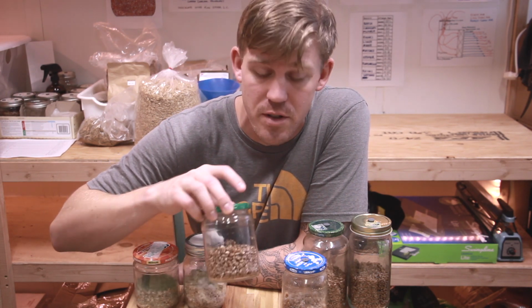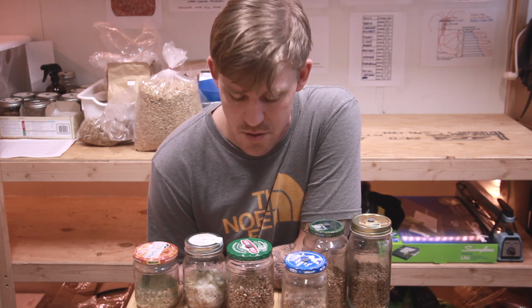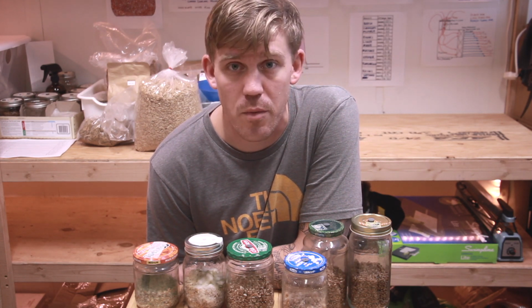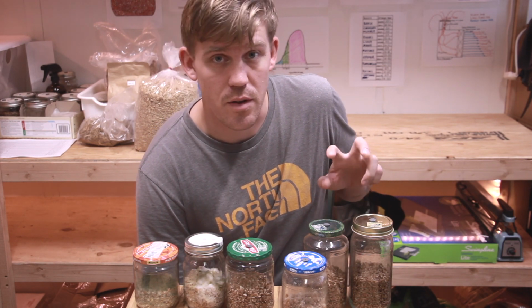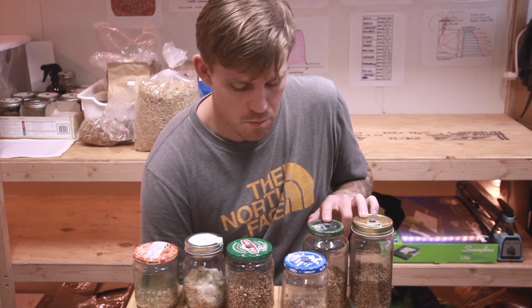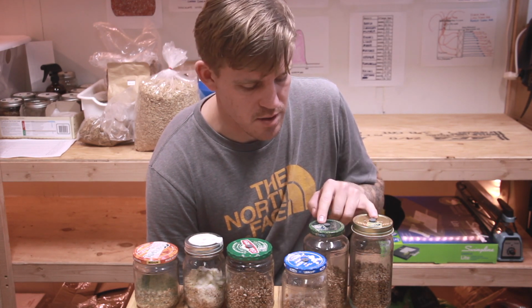So I'm going to leave this jar and let it recolonize, let the hyphae come back to full strength. And I think I'm changing my thoughts on what I'm going to do. I had intended on colonizing these two with either the pink oyster that I have in a jar or lion's mane, but I think I'm just going to do a grain to grain from this blue oyster, which looks like it's turning out pretty okay, onto these two.